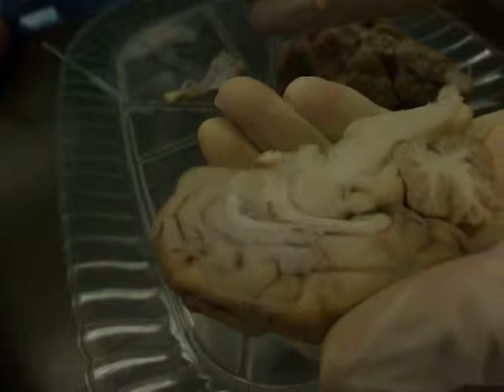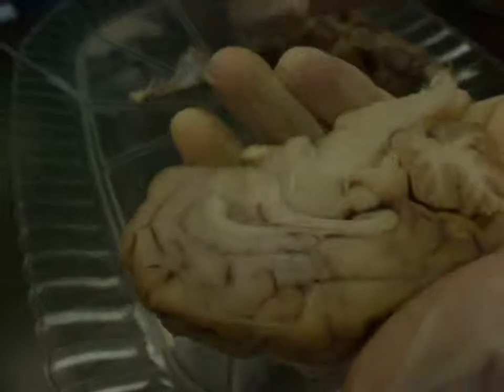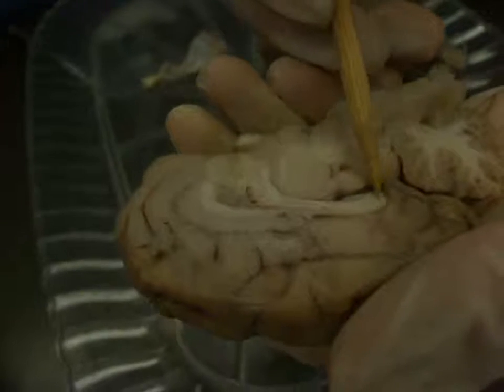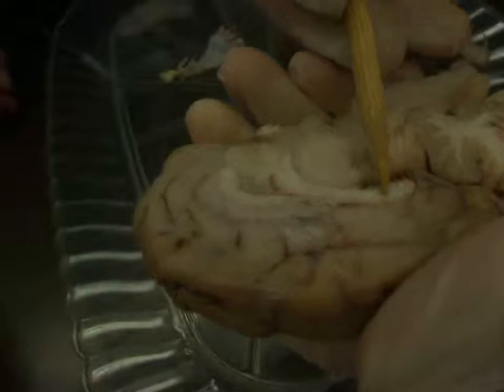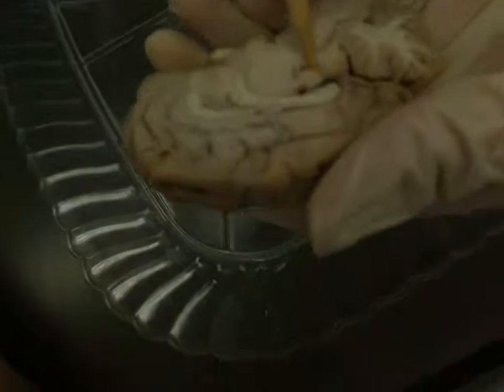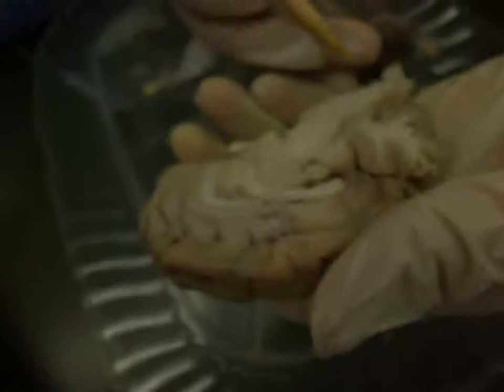That's mammillary bodies we're seeing in profile here. That's part of the hypothalamus. And pineal body is up in this region here. So you're just going to find the splenium of the corpus callosum, drop down a little bit more ventral, and you'll find the pineal body. Okay.